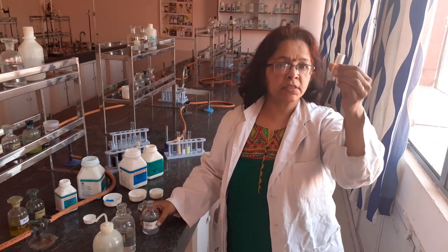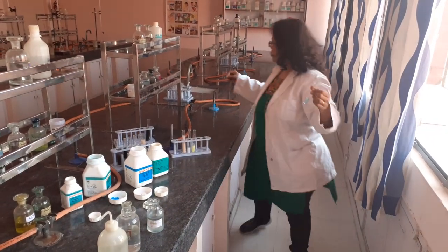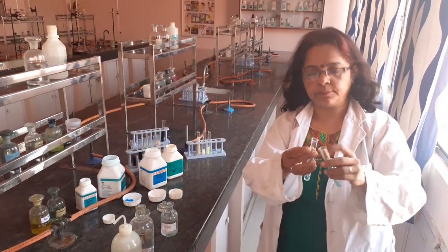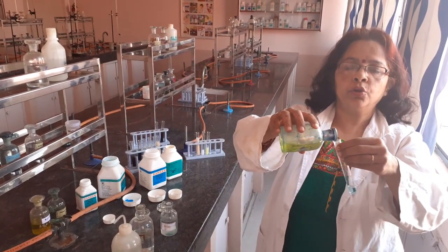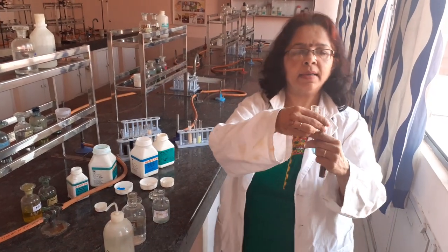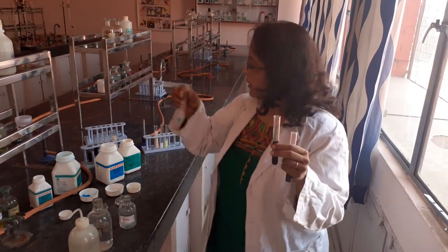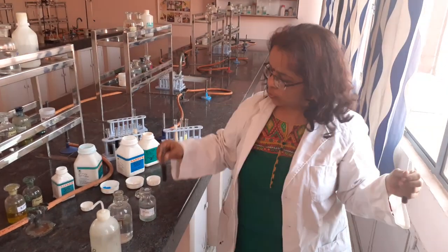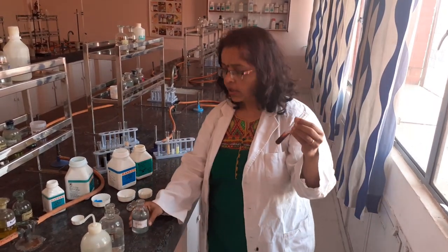You can also do another confirmatory test for copper, which requires your original solution. To this original solution, add K4Fe(CN)6. On adding K4Fe(CN)6 to the original solution of copper, you get a chocolate brown precipitate. So for copper: the OS will be blue in colour; add dilute HCl to check for lead — it will not be there; then add sodium sulfide to get a black precipitate of copper sulfide; confirm by adding potassium ferrocyanide to the OS to get a chocolate brown precipitate. Your magic reagents are sodium sulfide and potassium ferrocyanide.